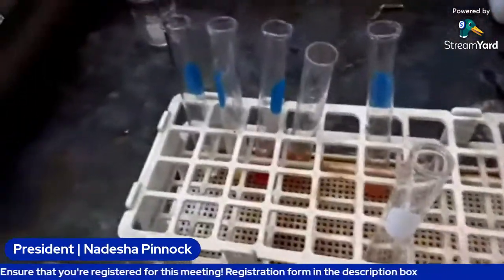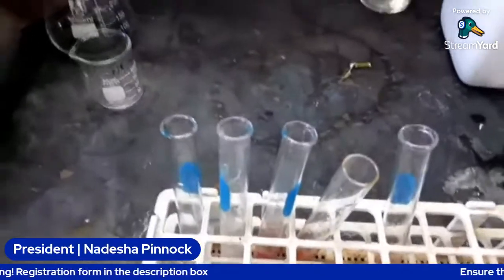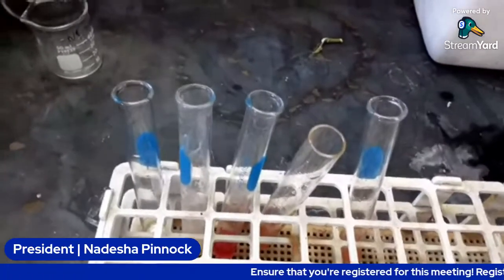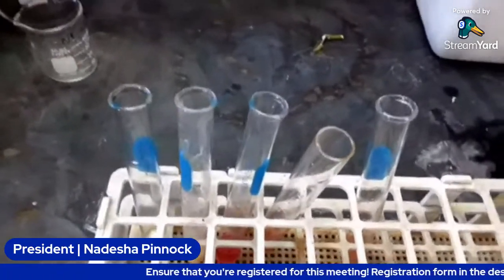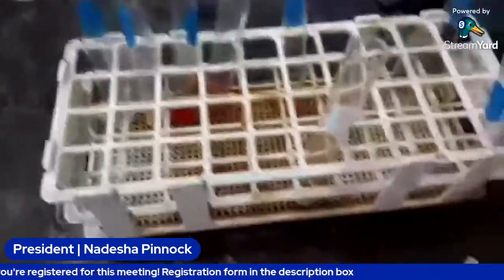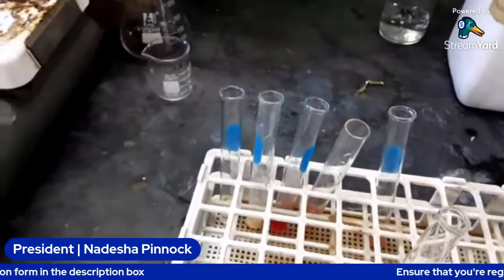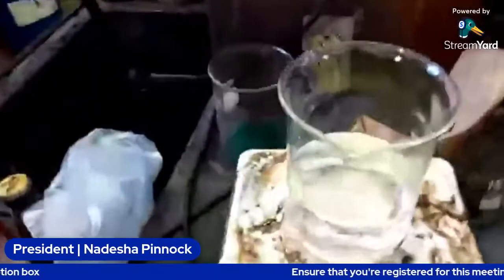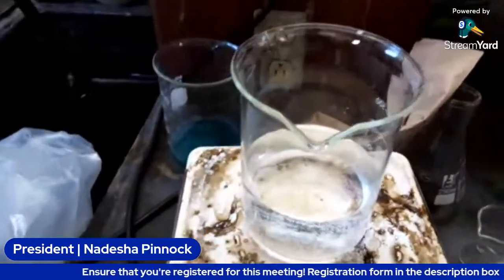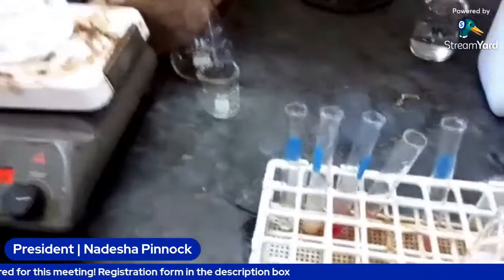So for our Benedict test, again, we're going to add about 2 to 3 mils of our Benedict reagent to the sample. We're going to stir it, and then we're going to add it to the heat bath or hot water bath. So this is our water bath that we're making. We're just heating the water so that it can get hot, and then we add the test tubes to it.